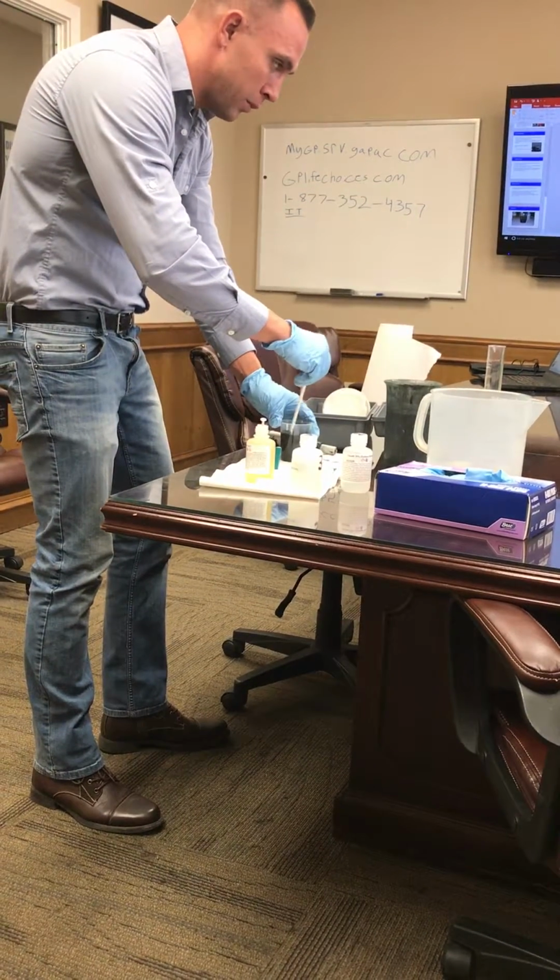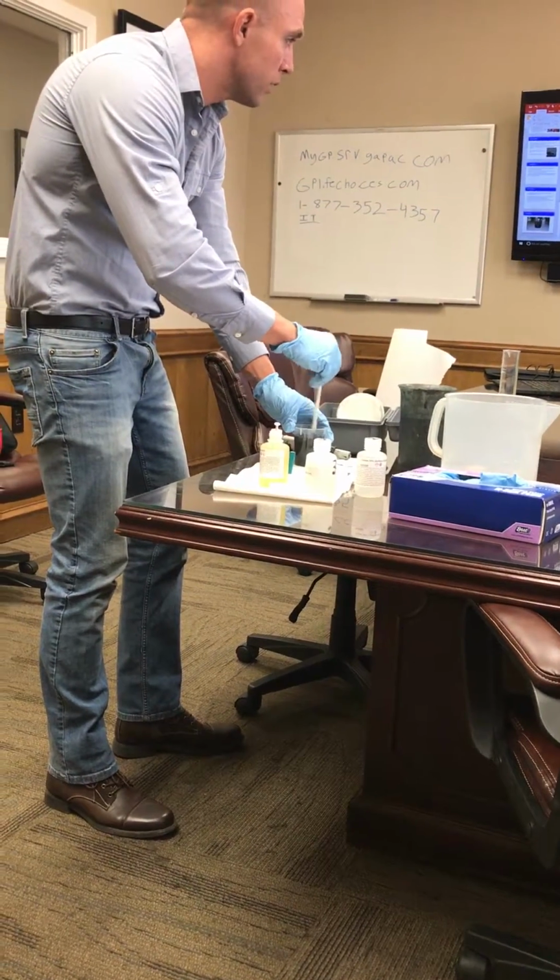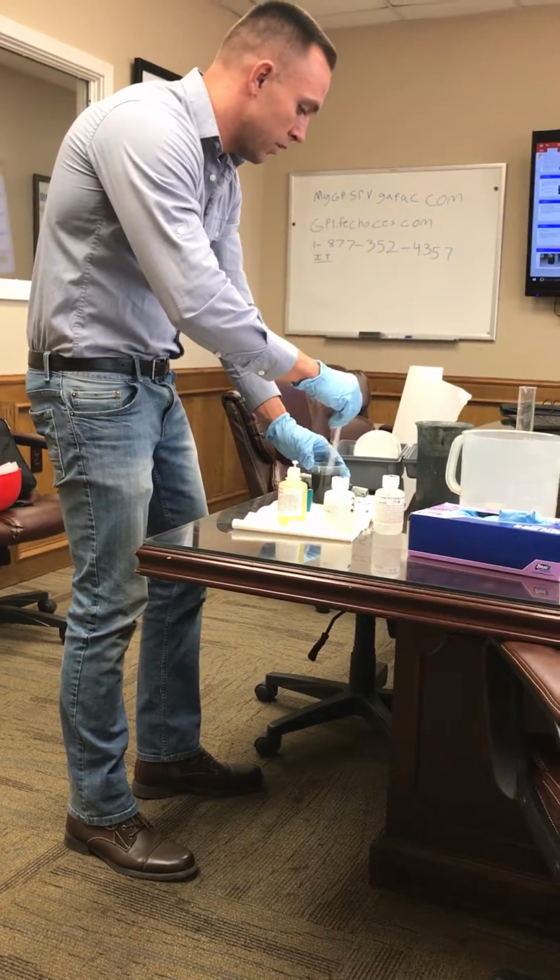You want to keep track. I'm just going to keep track in my head, but you want to keep track of how much you add, of course. At the end, you'll know exactly what you're going to add.